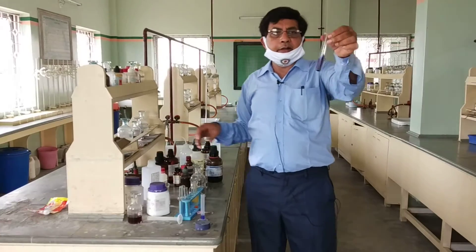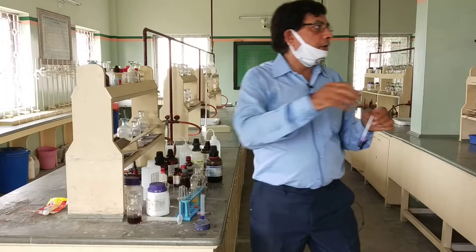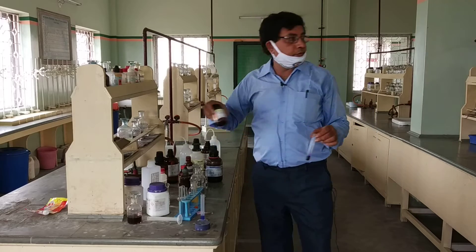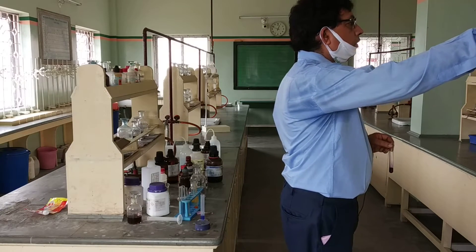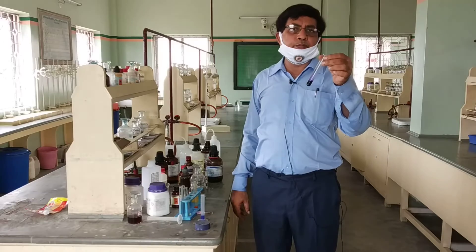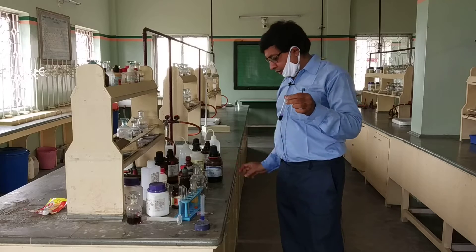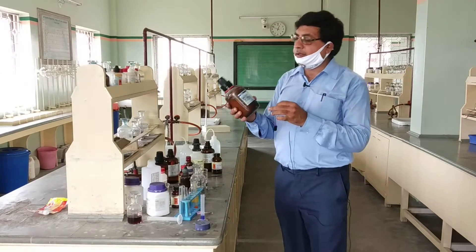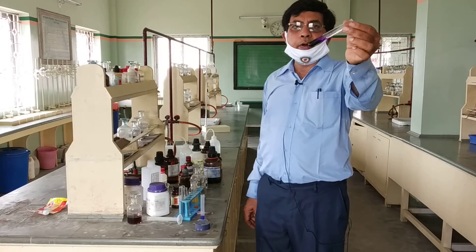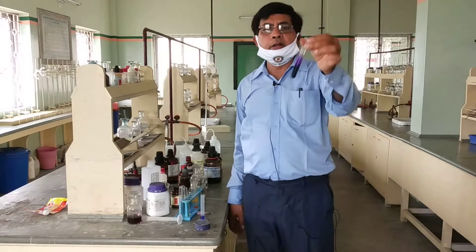So this is the test. You observe this color. For the test for ketone, you take the liquid sample in a test tube, add meta-dinitrobenzene, and add sodium hydroxide. A purple or violet color is obtained. This is the test for the keto group — note the color. It is a very simple test.